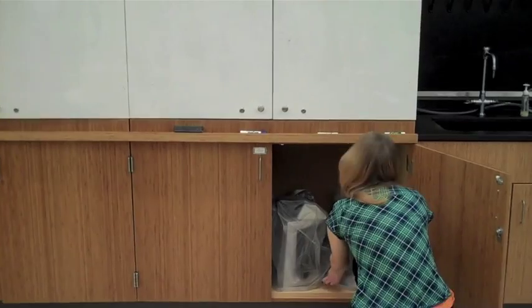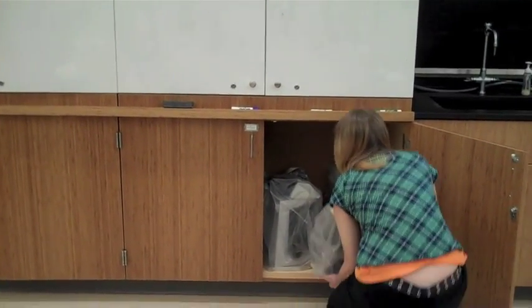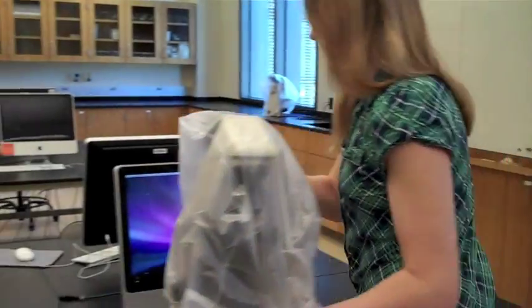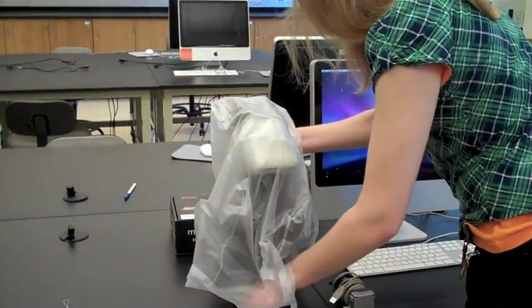Carefully take the microscope out of the cabinet. Hold the microscope with two hands. Make sure not to grab it by the stage. Take off the cover.